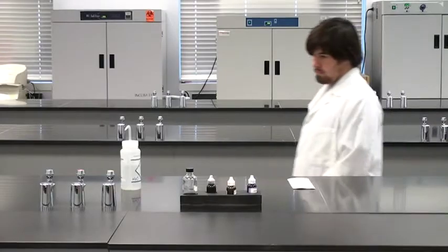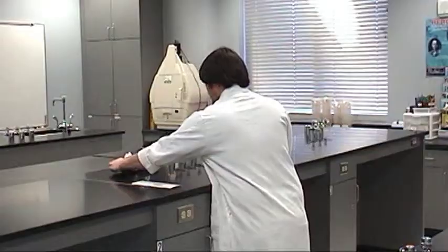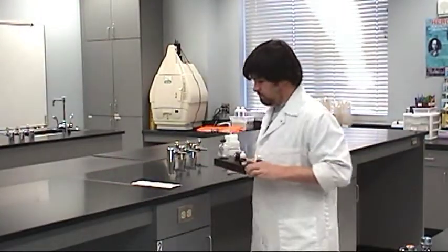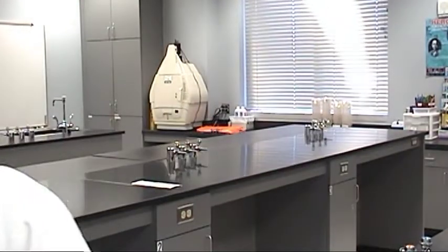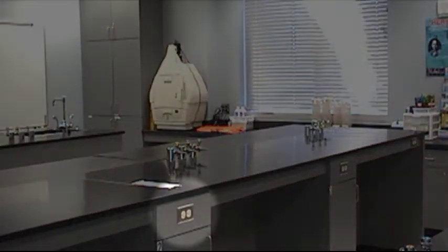Before you get the microscope, clear the area on your lab bench where you want to place it. Select an area with an electrical outlet nearby.